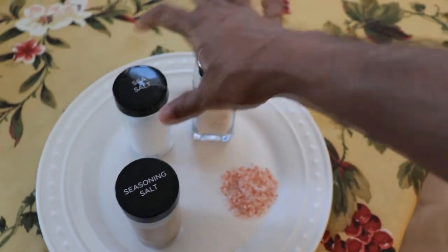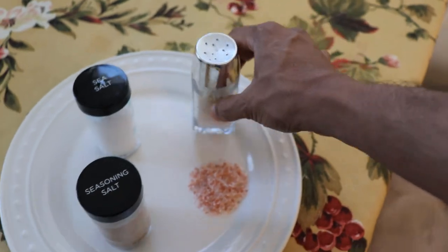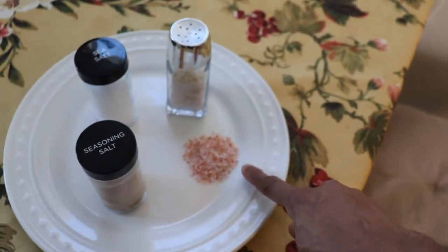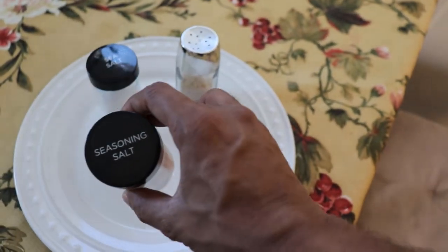Okay, we got sea salt here, regular salt, Himalayan salt, and seasoning salt.